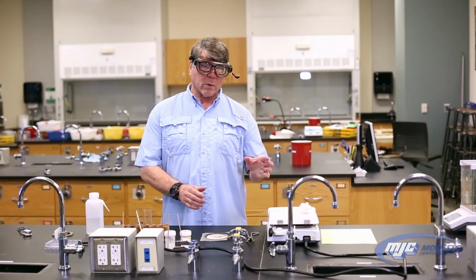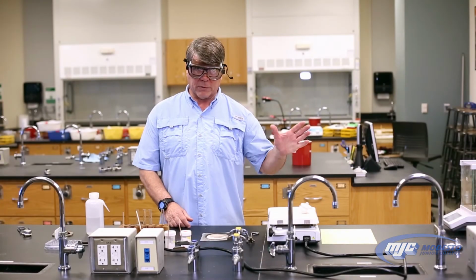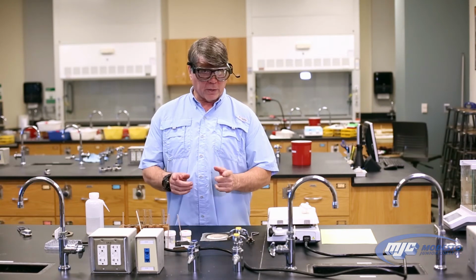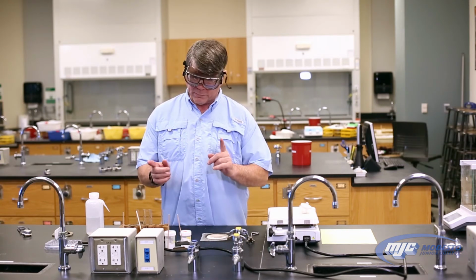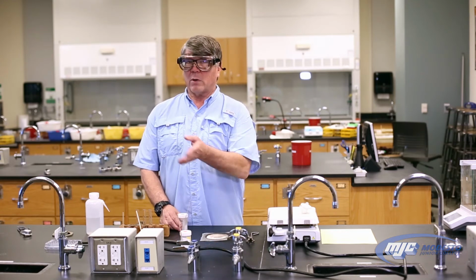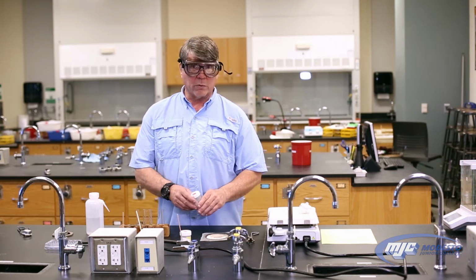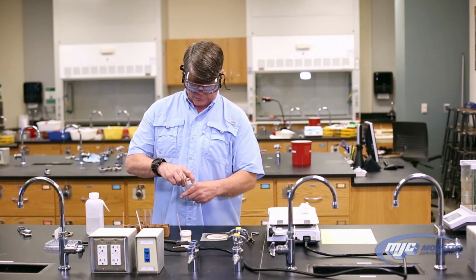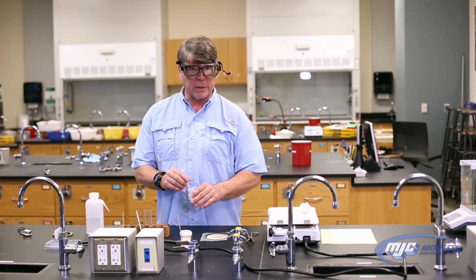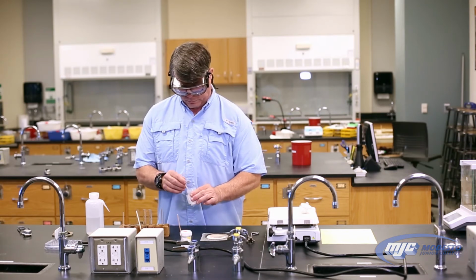All right, guys, so while we're waiting for our hydrate to heat up and to drive all the water molecules away, we're gonna do the flame test, and if we have to, the magnesium strip test. So what I'm gonna do though, is I'm gonna show you what all the unknowns would look like, so you get a chance to see. In your data, you're gonna get one of these. You're gonna see a picture of one of these.